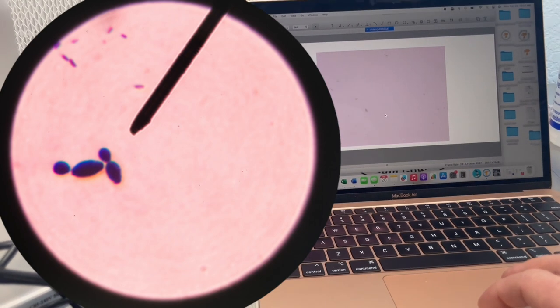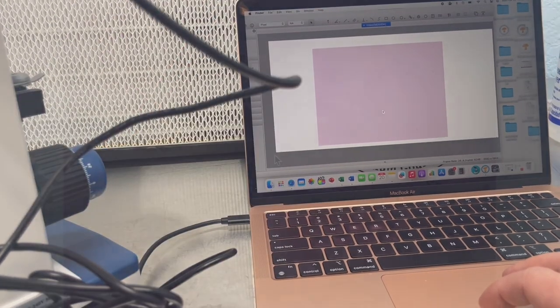But you can see that this region right in here, where there's a bunch of clusters of bacteria, looks like possibly a yeast. So this almost looks like a budding yeast as well. As you can see, there's definitely some limitations. People could get confused with the different fragments that could be present in the liquid culture.